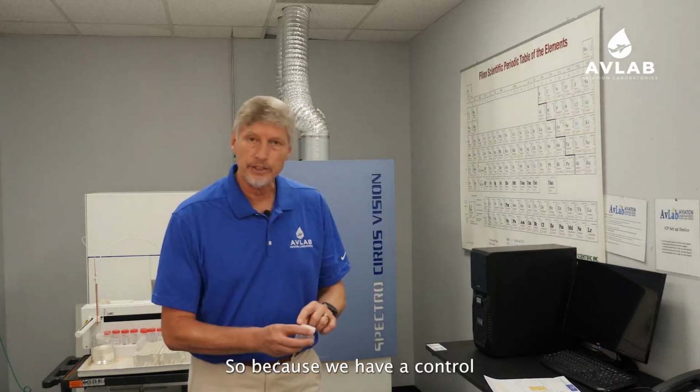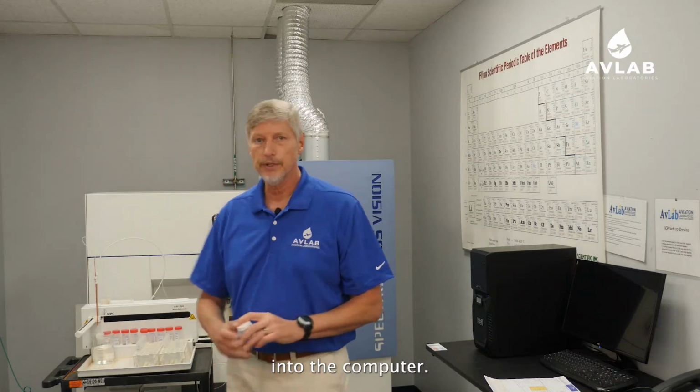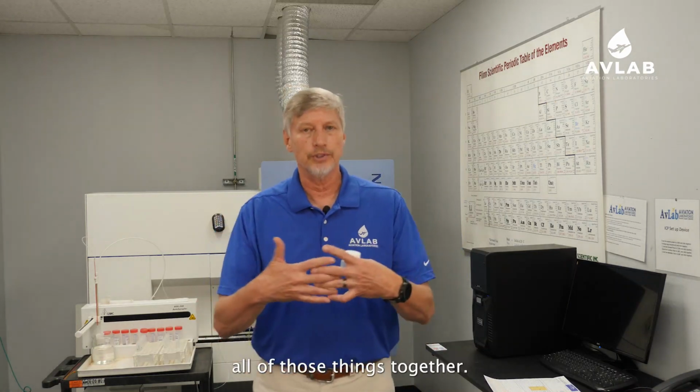Because we have a control number assigned to them, we enter the control number into the computer. It's recognized by our ICP. So when we do the analysis, we can mesh all of those things together.